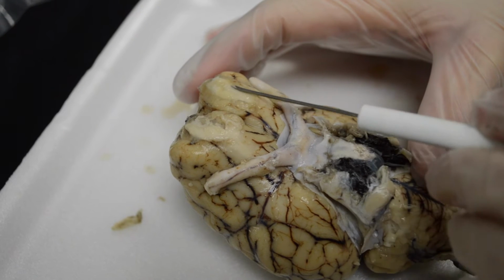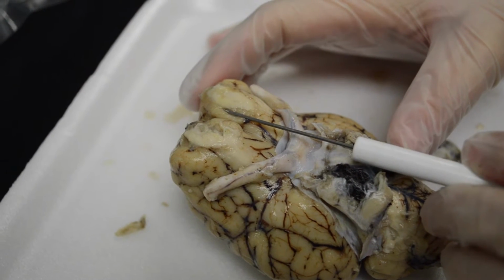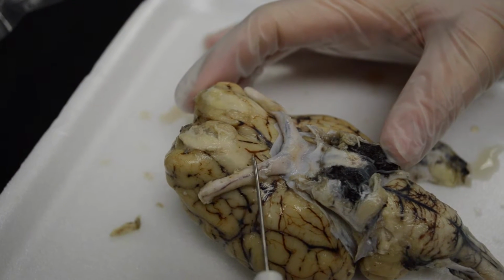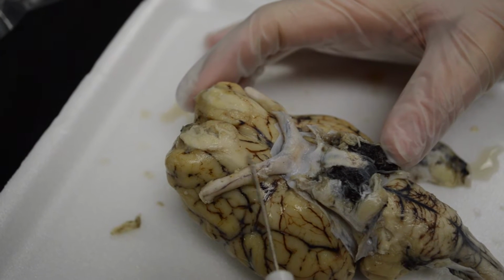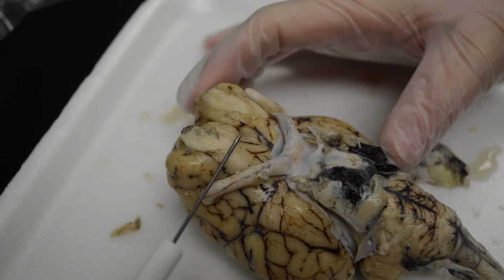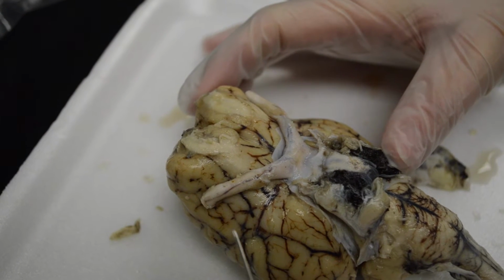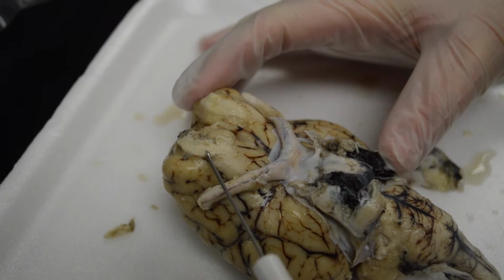These are the olfactory bulbs, and olfactory, this is for the first cranial nerve, and they are for smell. An extension of the olfactory bulbs are the tracts. So these are the axons, right? The bundles of axons that will extend from the sensory portion of the olfactory bulb. Okay? That connects with the sensors in the top of the nose.